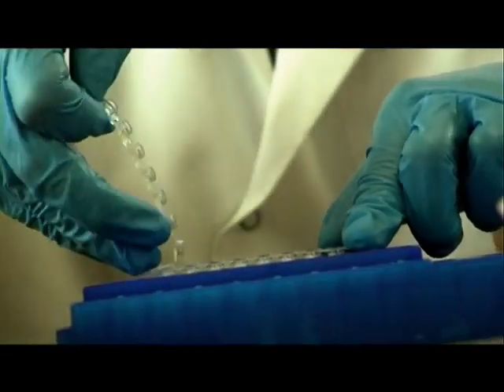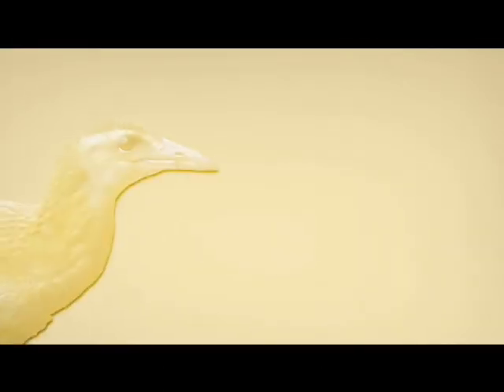Restriction digestion is the process by which double-stranded DNA is cut using enzymes called restriction endonucleases. These enzymes recognise and cut specific sequence motifs. This process is an important step in many molecular biology methods. Today we will see how restriction digestion can be used to detect differences between two fragments of DNA. For many species of birds, it is very difficult to tell males from females based on appearance alone. Fortunately, a solution to this problem has been developed using restriction enzyme digestion.